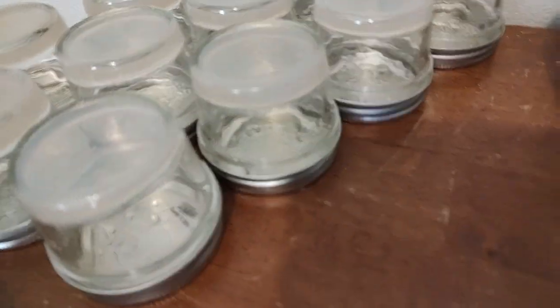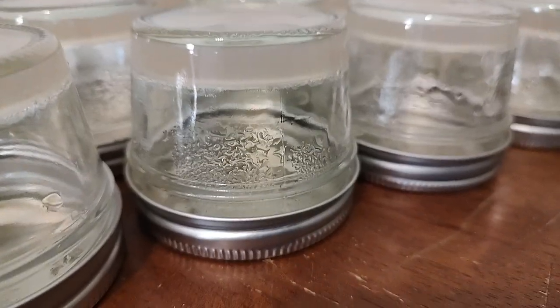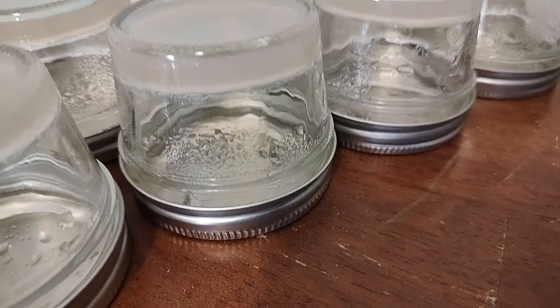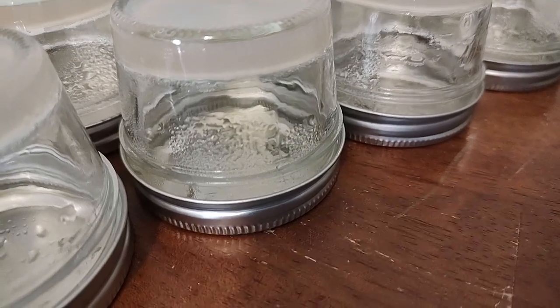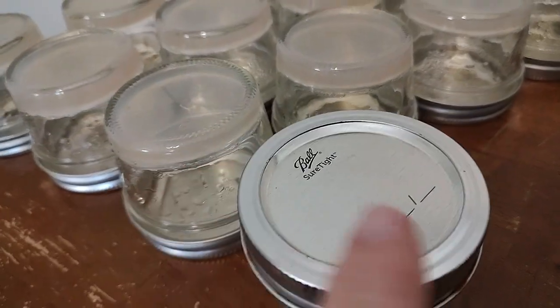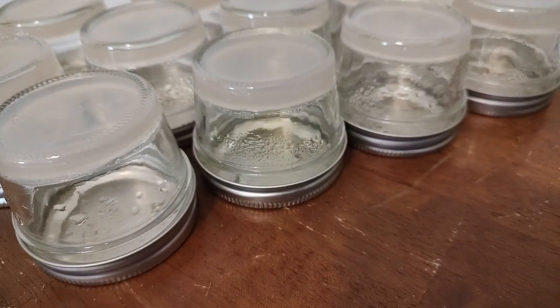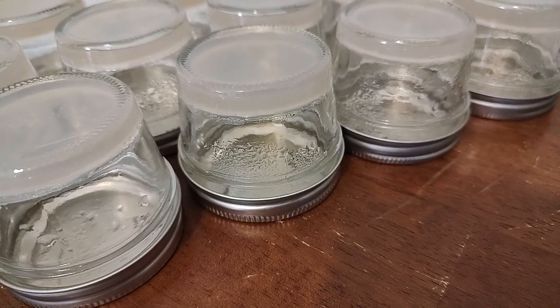I wanted to show you all this moisture — you can see how it's rolled down into the lid. What's fascinating is all the moisture is actually on the top of the lid, because those are flipped. So you're seeing the top of the lid that has all that moisture. What's really handy is that all that moisture in there has been through the pressure cooker, so it's sterilized.